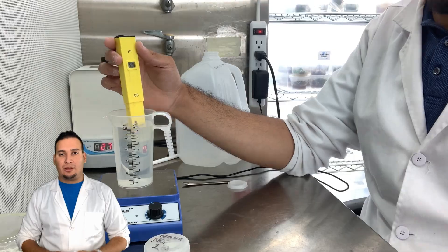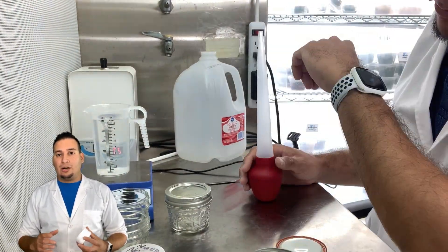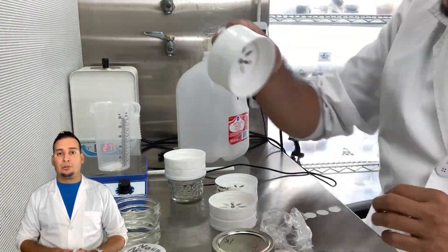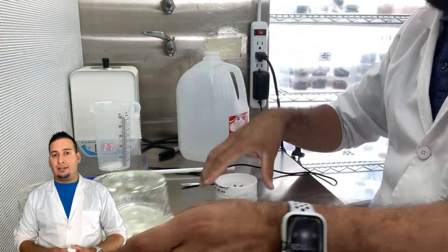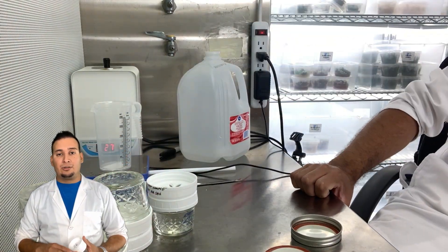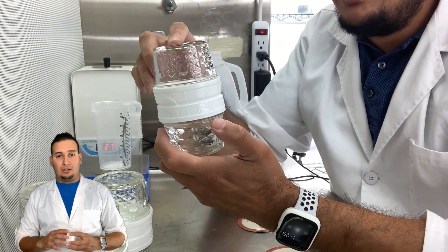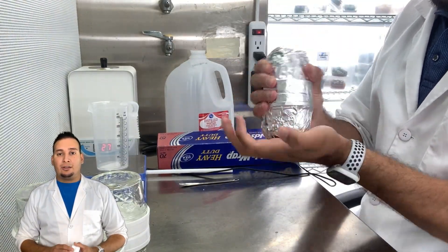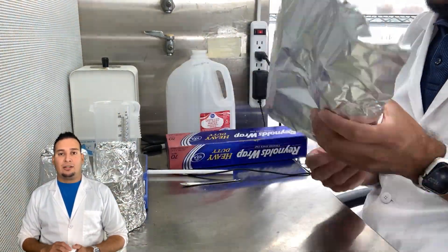In my case I was experimenting with carnivorous plants, so I used the typical carnivorous plant media I always use. The only difference is that I didn't use any gelling agents — no agar, gelzan, or whatever other gelling agent you typically use. This is essentially liquid media; other than that it is the same medium.